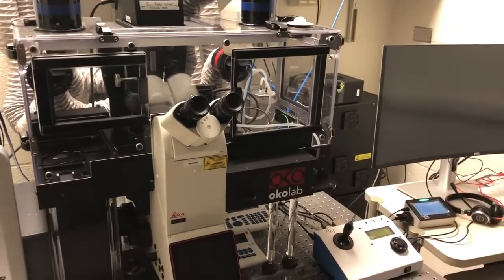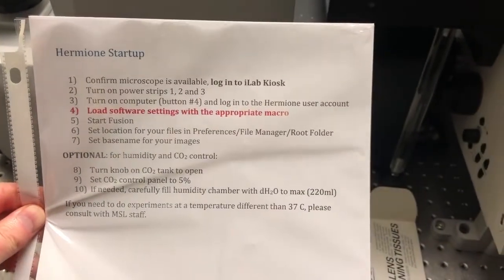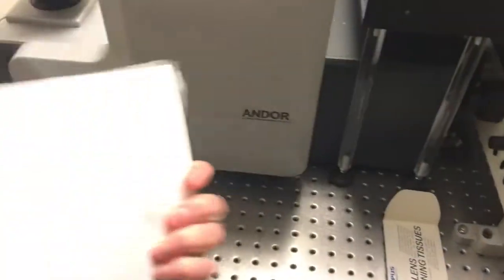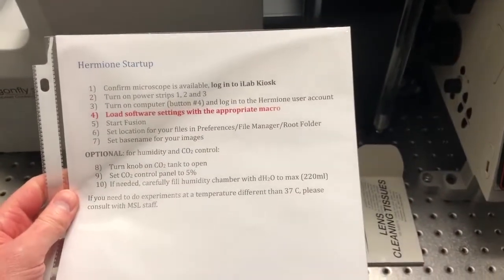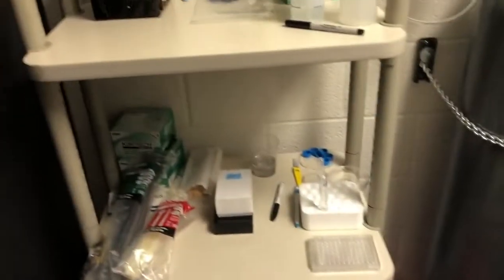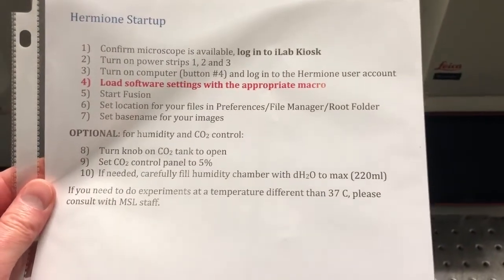To start up the Dragonfly system, we are going to follow instructions on this startup sheet, which has the startup instructions on one side, the shutdown instructions on the other, and will always be in this room either on the air table, on that desk, or on this little auxiliary shelf. We're just going to go through the startup instructions one step at a time.